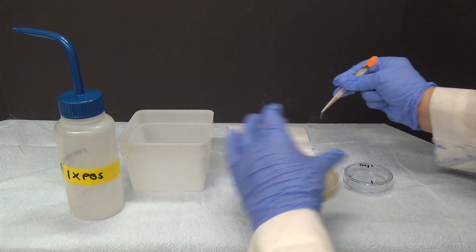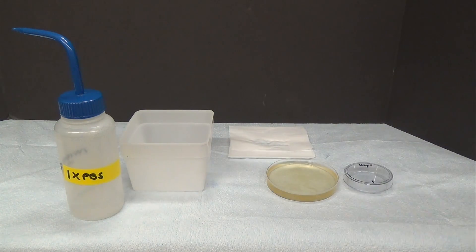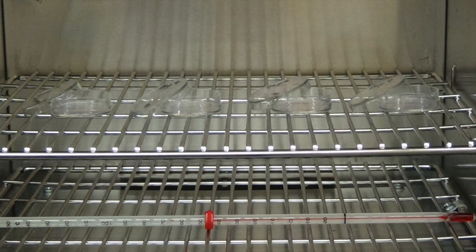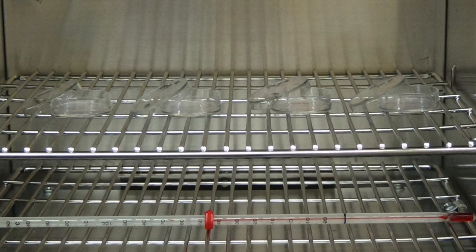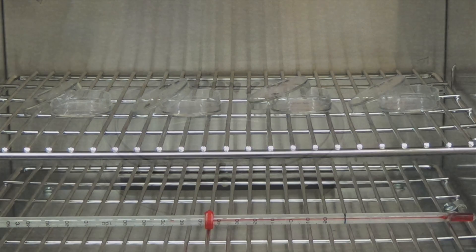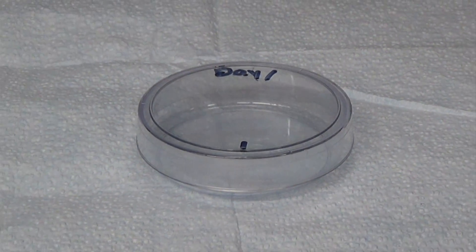Place each cover slip into its own labeled 60mm petri dish. Let the cover slips dry in an incubator set to 60 degrees Celsius for 15 minutes, with the lids slightly ajar. After 15 minutes have passed, be sure that the cover slips are completely dry. If they're not, allow them to dry until they are.